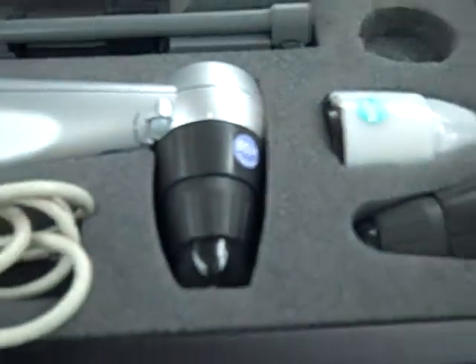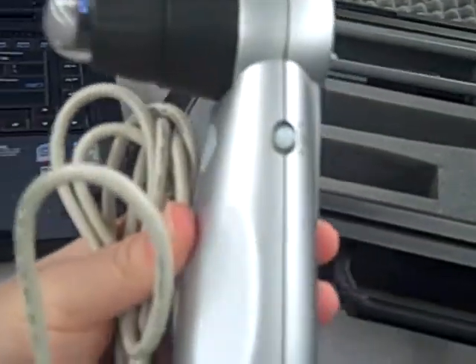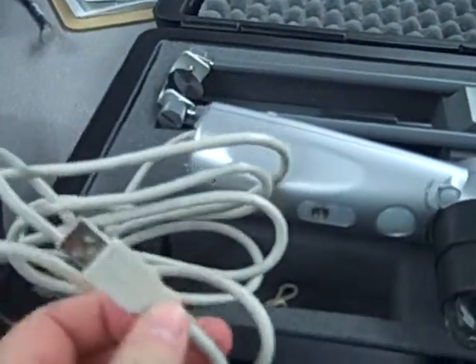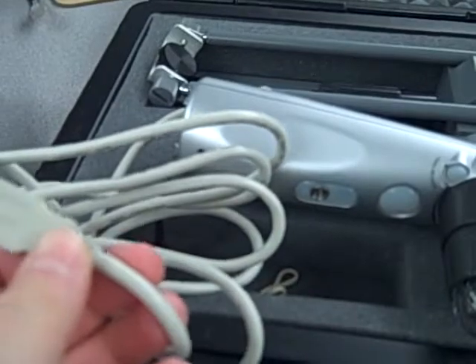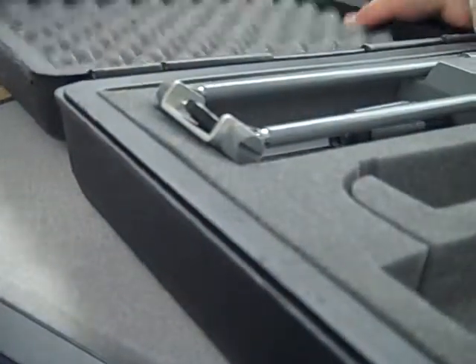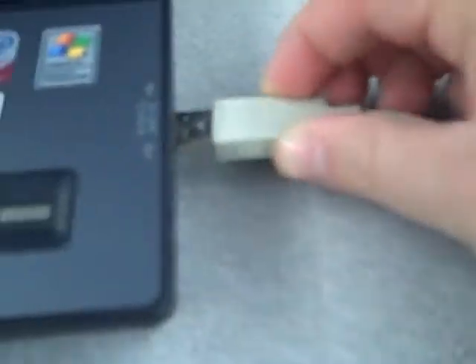So you're just going to take the ProScope out of the box, and at the end of the cord is a USB attachment that simply plugs into the side of your computer. Let's see if I can get that to zoom in for you. So you're just going to plug it in to the side here, and then you're ready to use your ProScope.